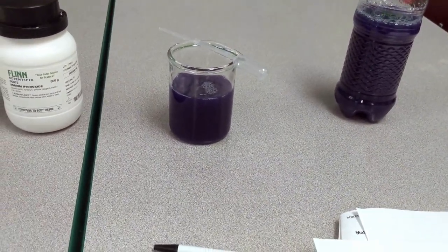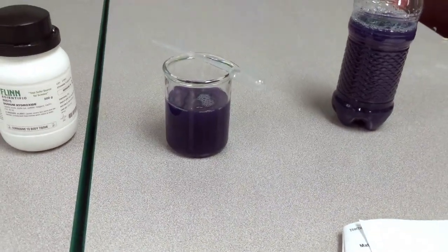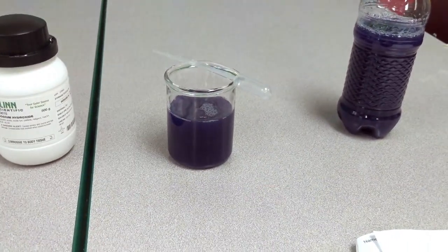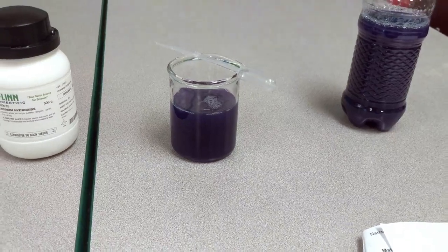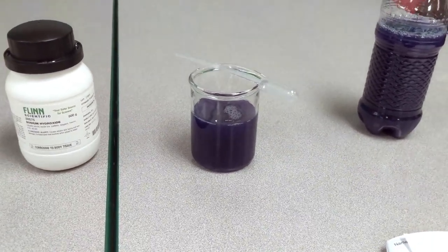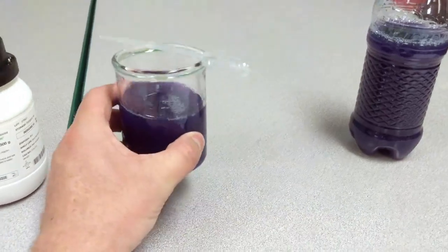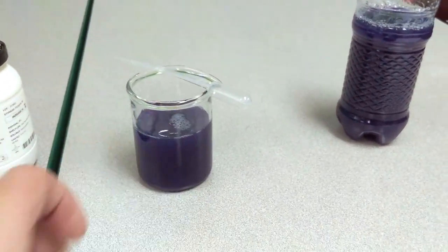Anthocyanin can also be found in fruits like blueberries and blackberries, and even in red cabbage, which is where we're going to extract it from. Let's go back in time and I'll show you how I actually extracted this anthocyanin from red cabbage.